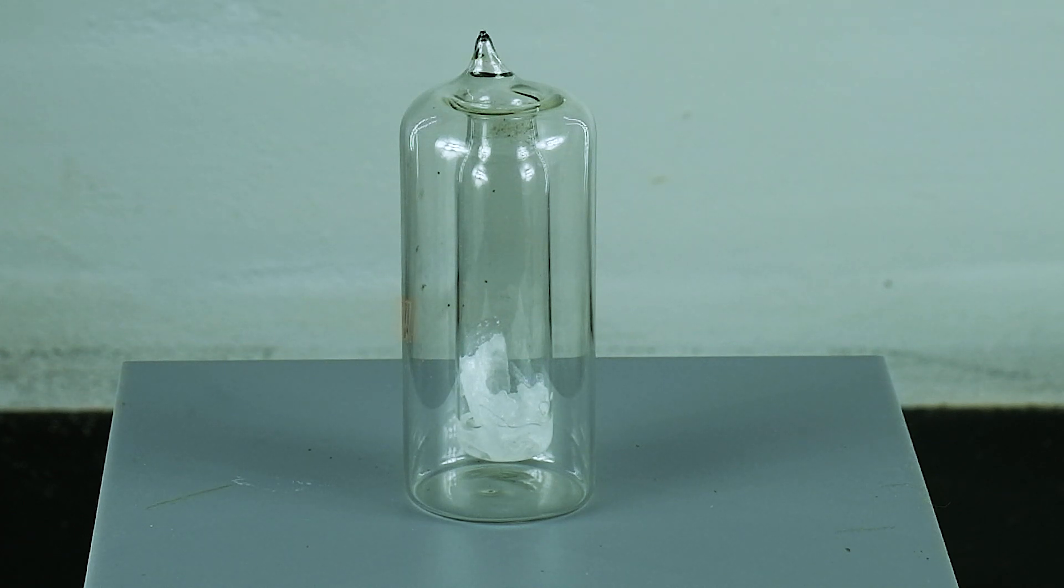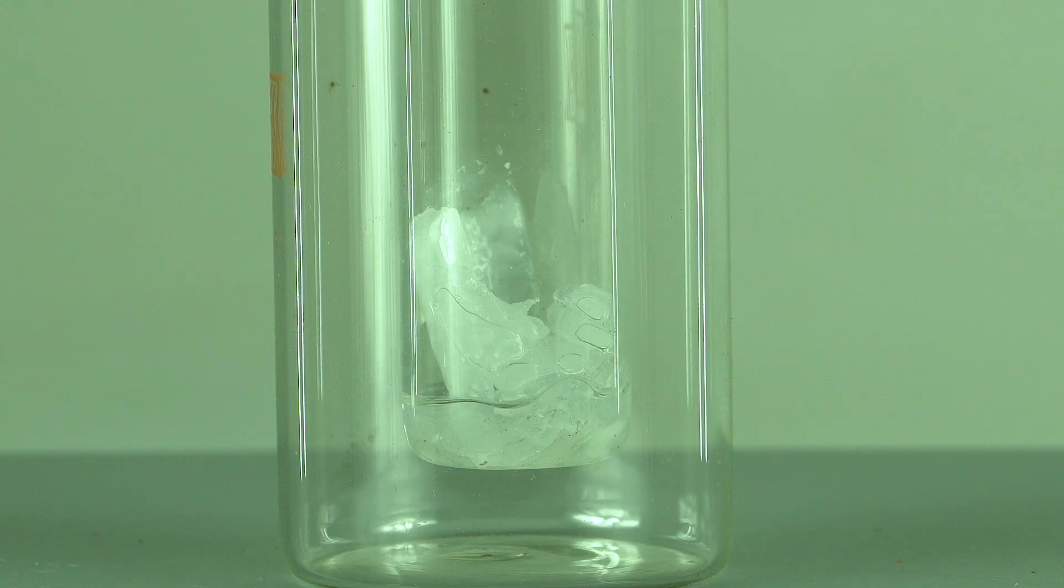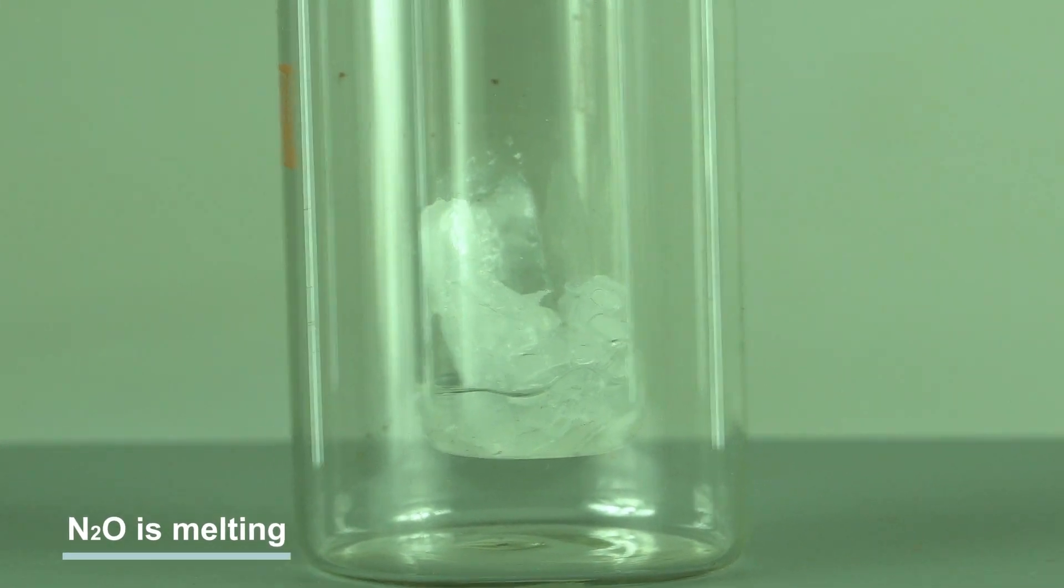Hello, guys! I hope that eventually I will be able to show you the reactions with all nitrogen oxides. And in this video there will be reactions with its lower oxide, nitrous oxide.